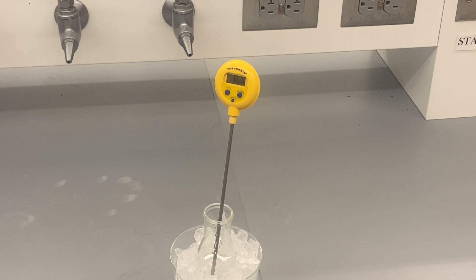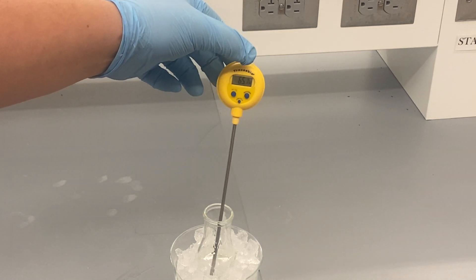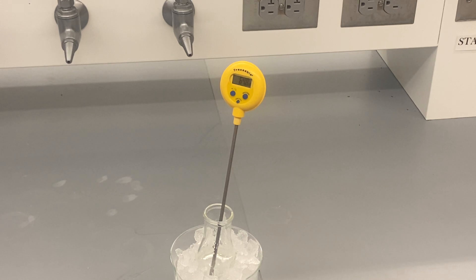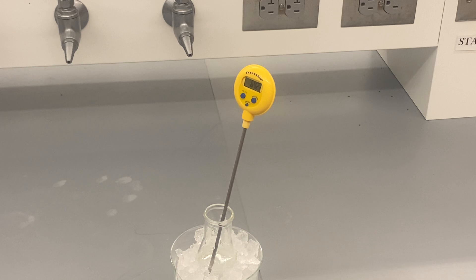And it won't take long — it'll drop pretty dramatically. That drop will slow down as it gets closer to the freezing point, since that's more or less what the temperature of the ice is. But this is a really good method for rapidly cooling off a mixture. A lot of times the reason you're going to want to do this is to get a solution to precipitate.